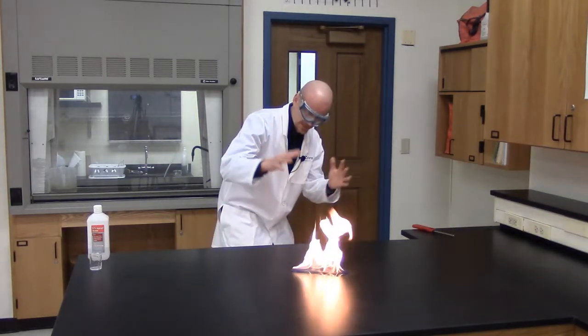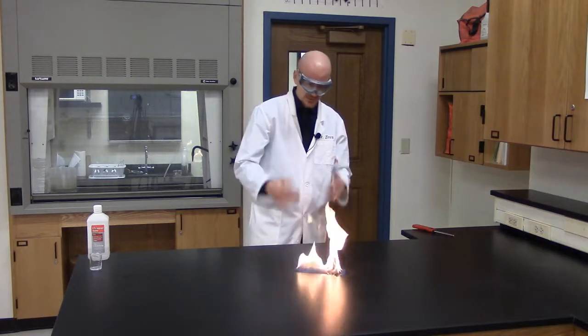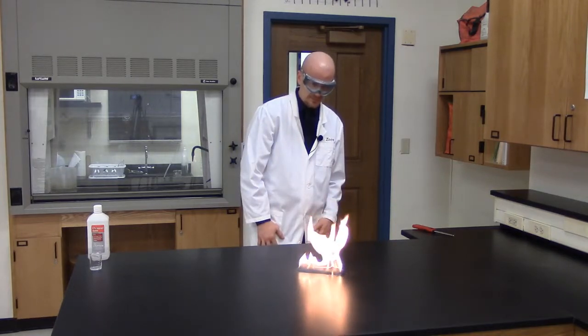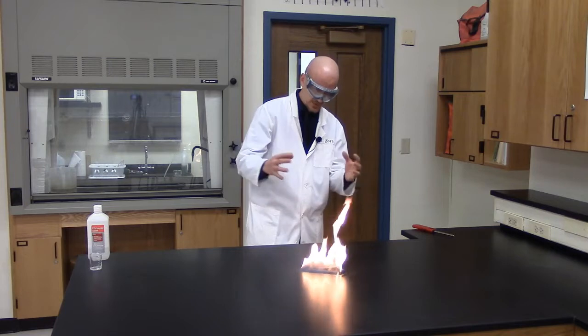So as you notice, the fire is starting to get a little bit smaller here as the fuel is consumed. Still going. Starting to shrink now.